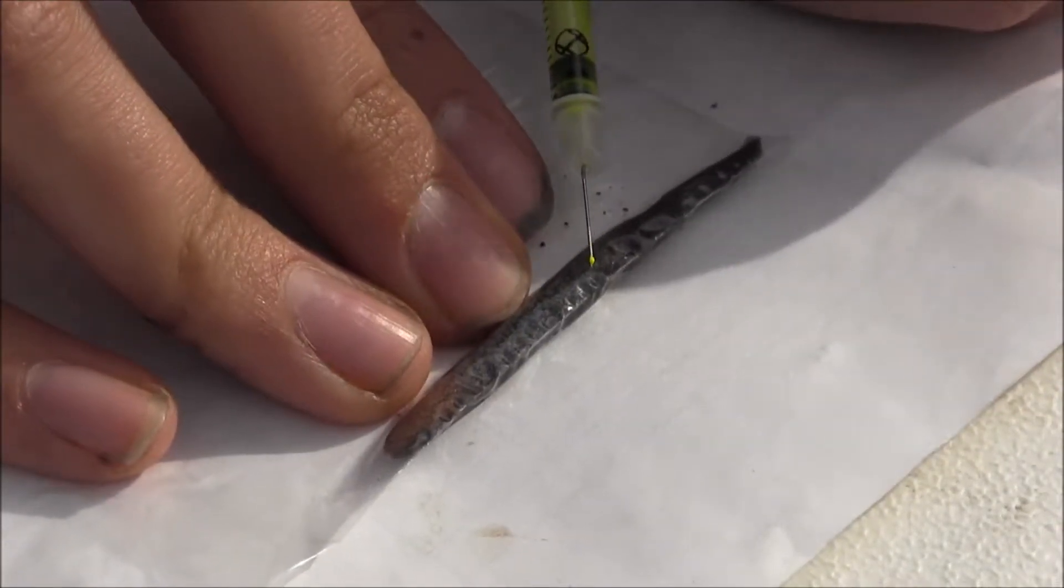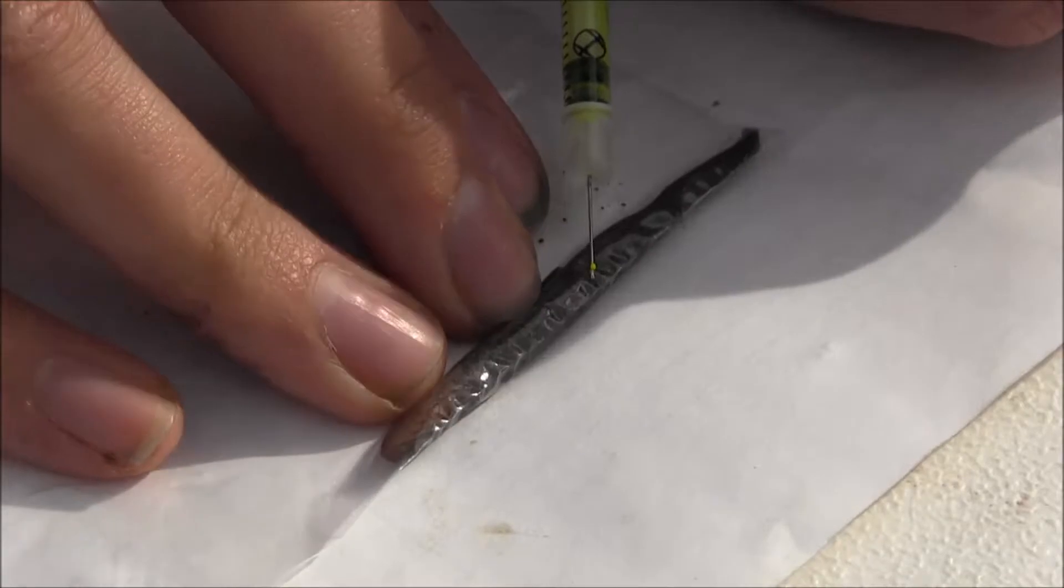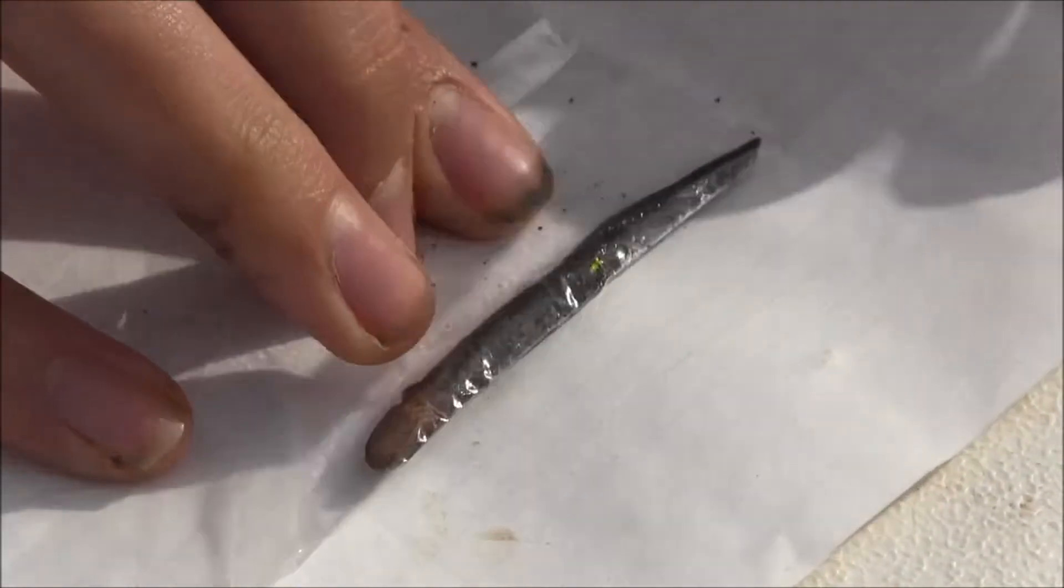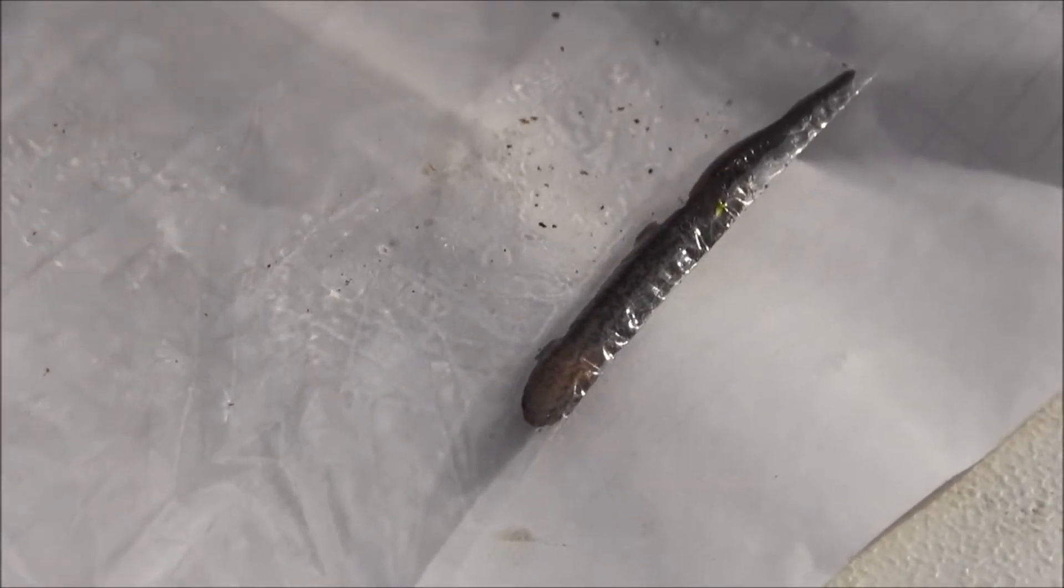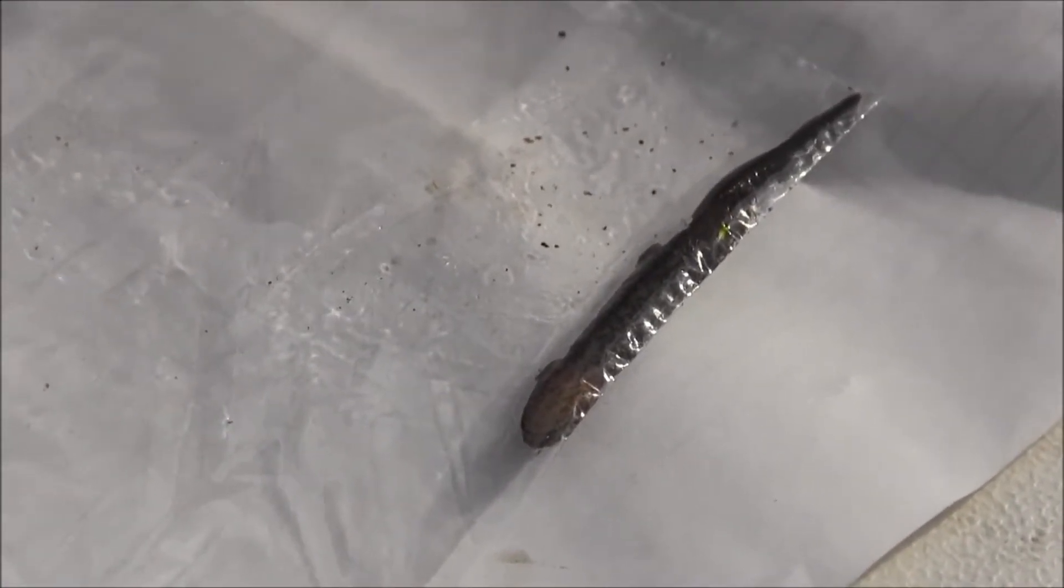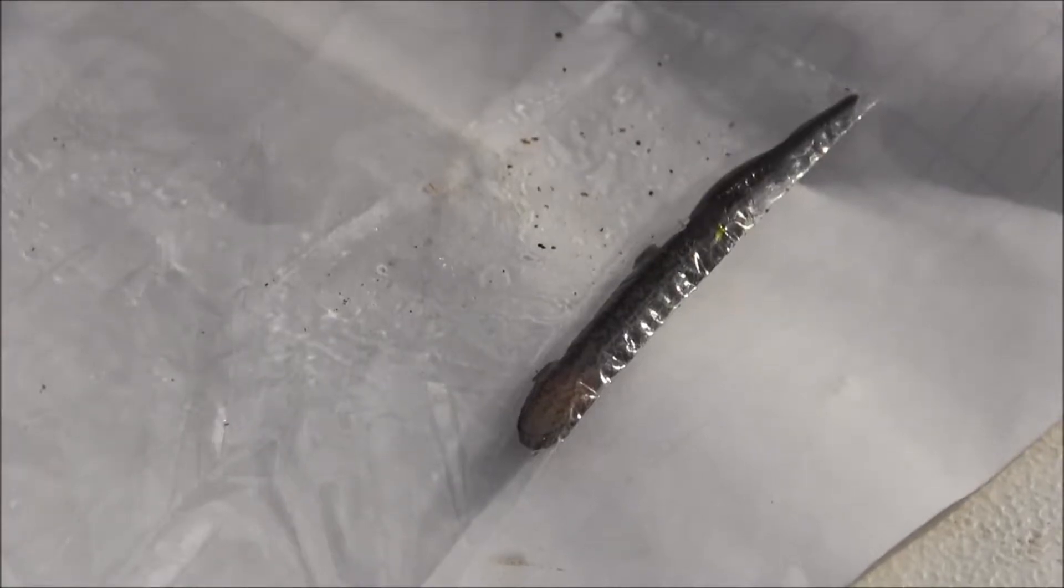So then, I slide it under. Sometimes they wriggle. It's not meant to be pleasant, but it's better than traditional marking techniques.